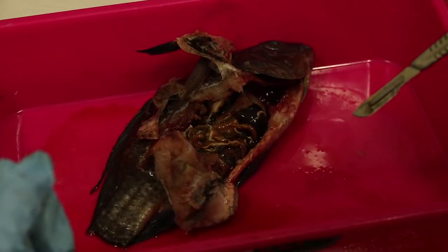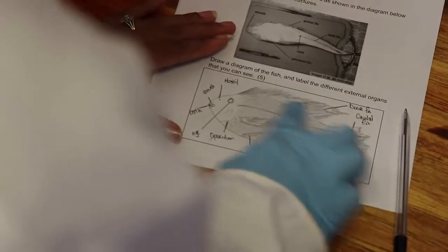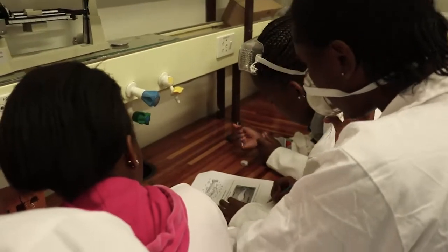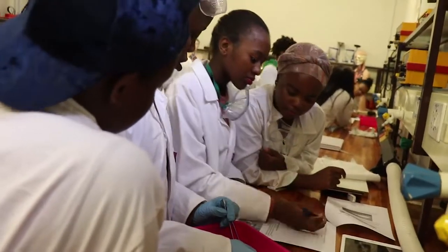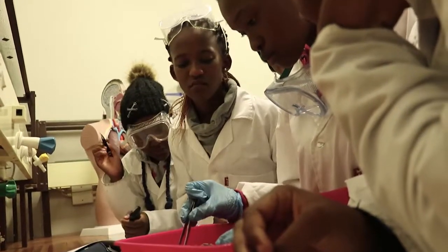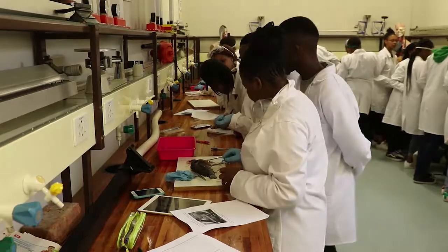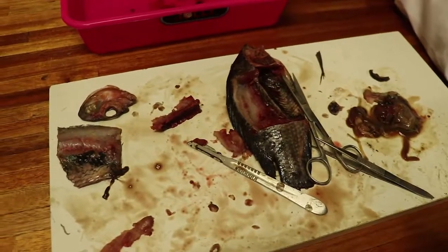Today we are looking at organs and organ systems. One of the themes in our module is the origin of life, and part of that is looking at the hierarchy of life. So we looked at the different levels of life, and two of those levels are organs and organ systems. We did that in class theoretically, so in this practical we are trying to expose the learners to real life organs and organ systems. In this case we are going to use a fish.